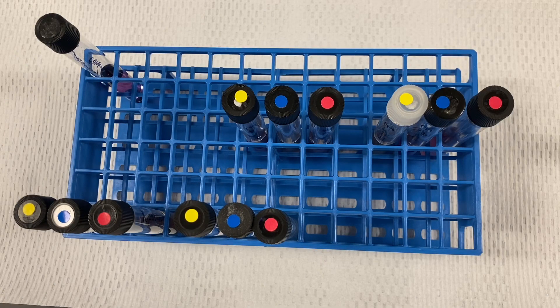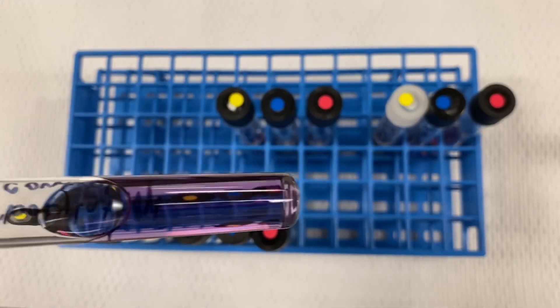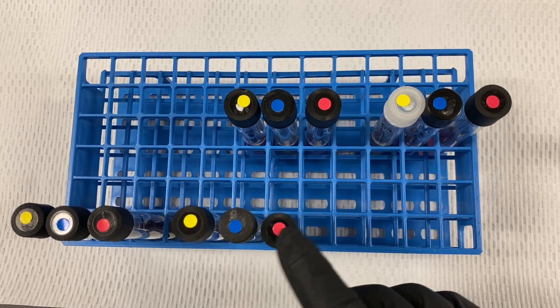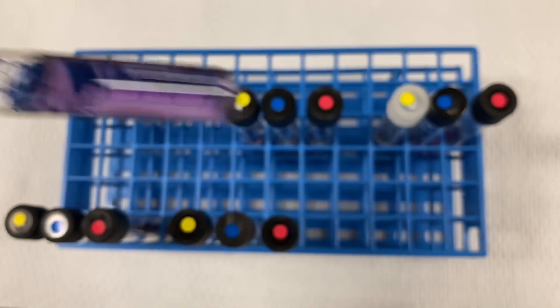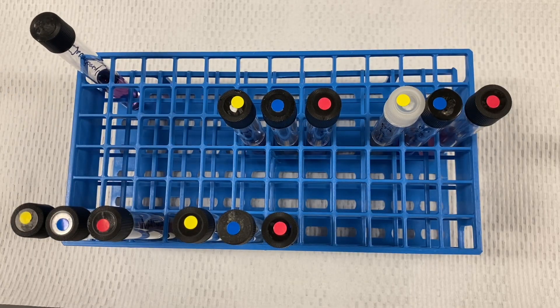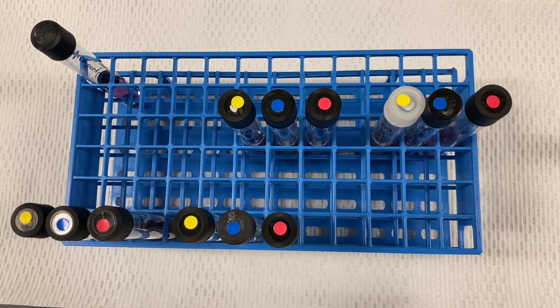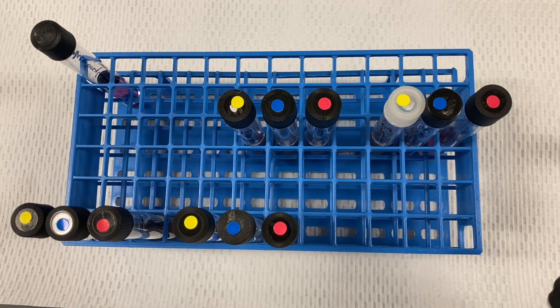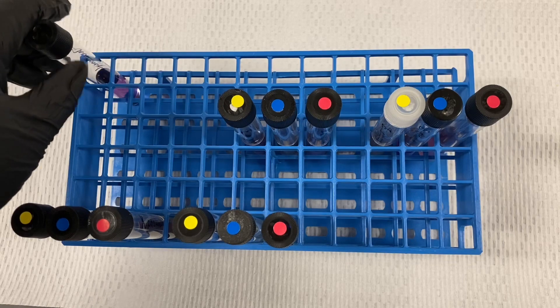For lab 23, the decarboxylation of amino acids: we will take media that has been enriched in a particular amino acid. We have three amino acids — lysine, arginine, and ornithine — identified by the color of their dots, but they all start with media that looks violet or purple. Your job will be to add some sterile mineral oil on top and then wait in this anaerobic environment to see if the organism can utilize that particular amino acid.